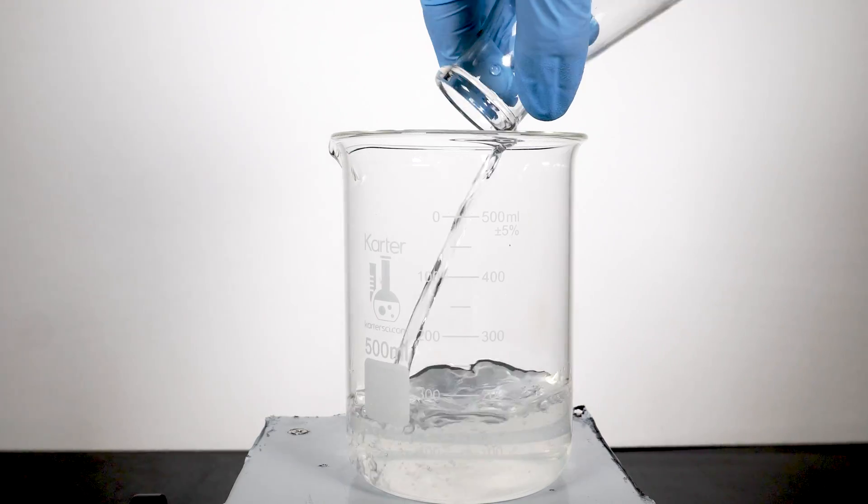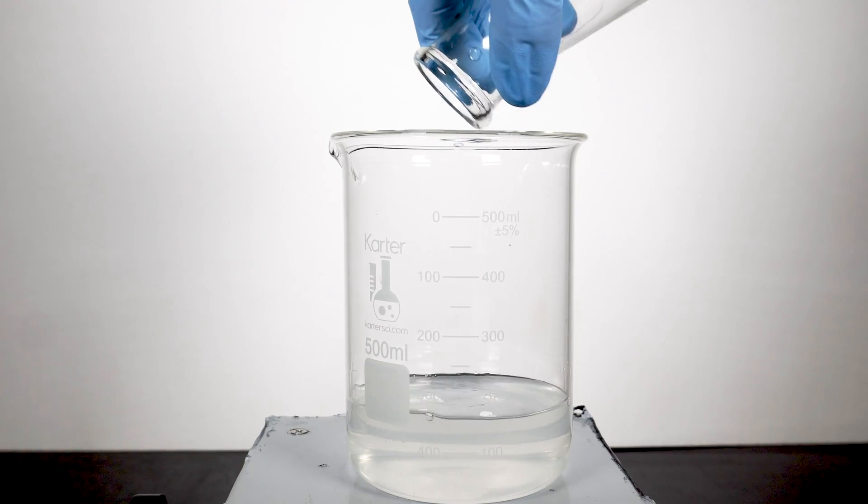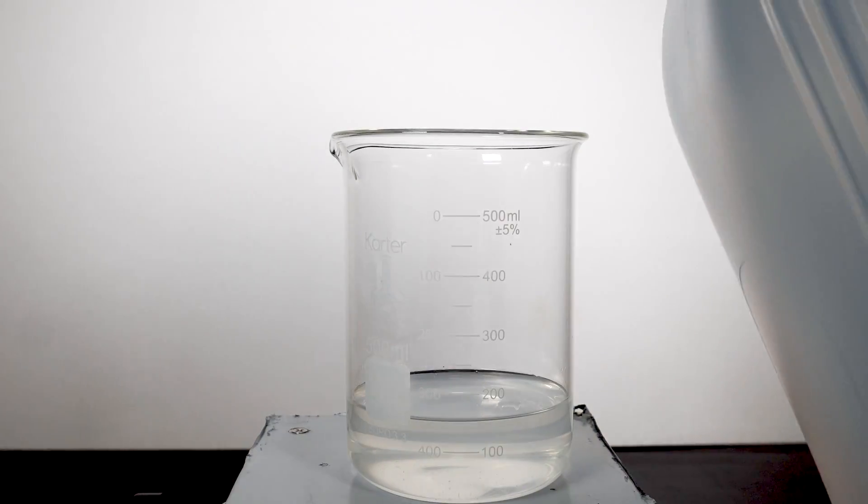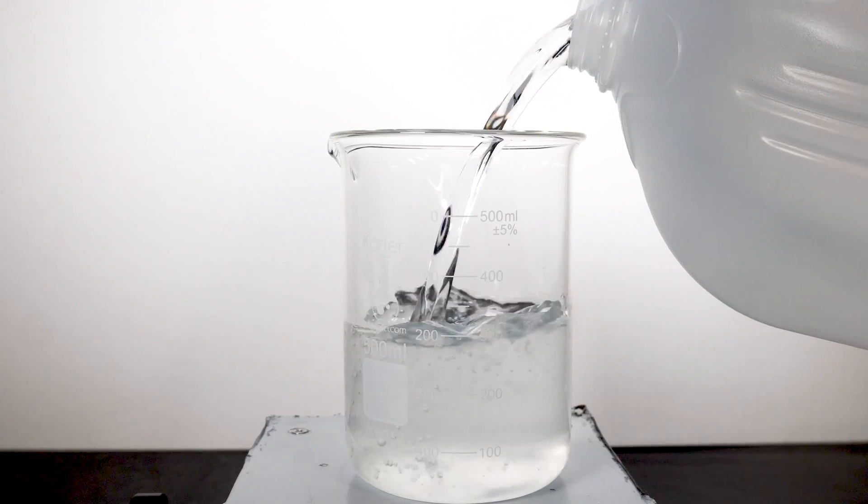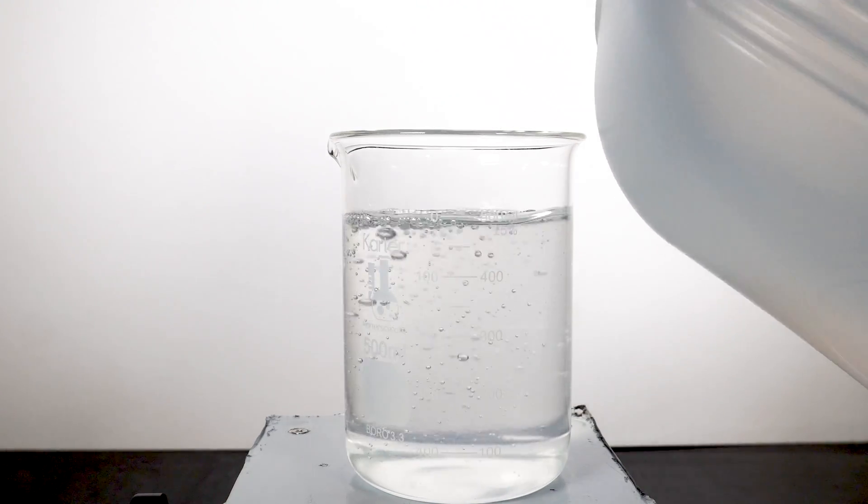I will then dump this solution into a bigger beaker, followed by topping off the solution to 500ml with distilled water. This solution is complete, and now we can move on to making the second solution needed.